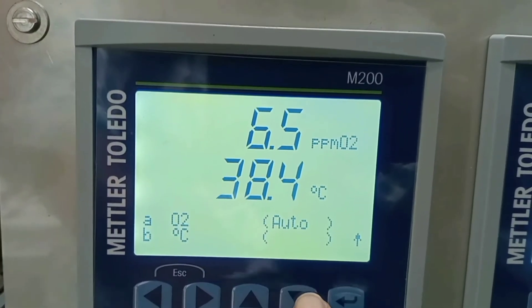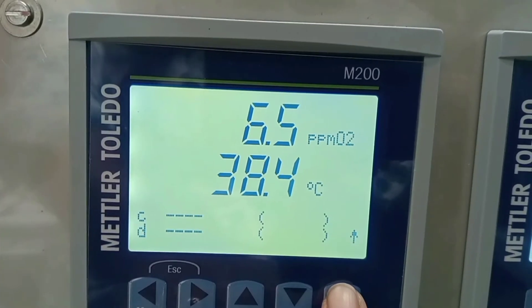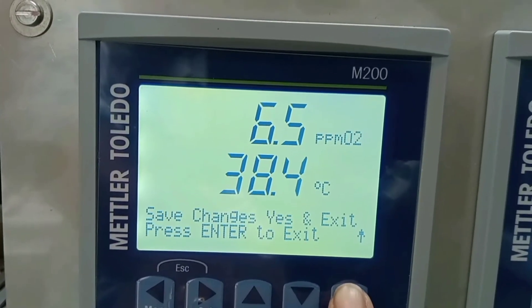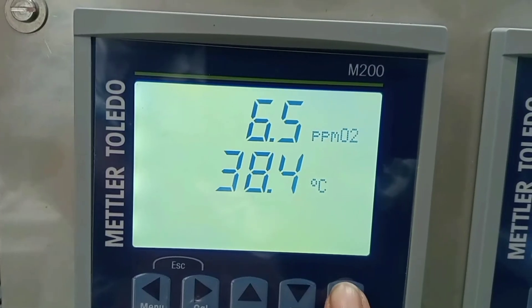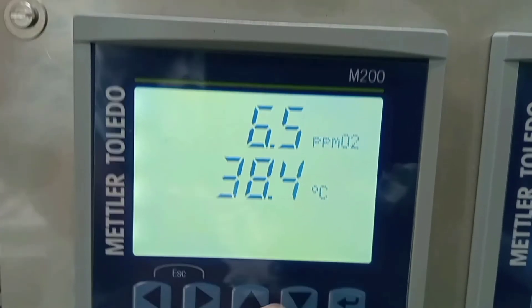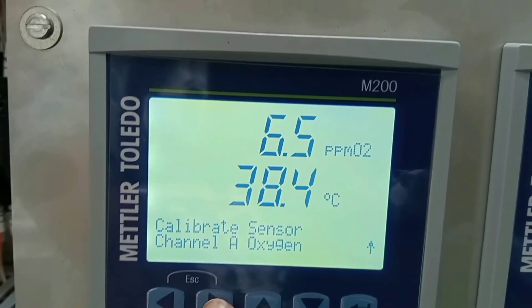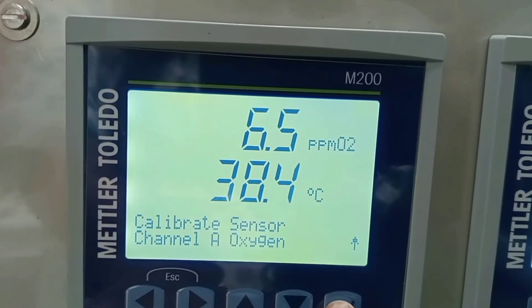After this, enter once again, save the changes, and enter once more. The basic configuration setting of the transmitter is now done. Now we will move forward with the calibration activities — press the calibration tab.